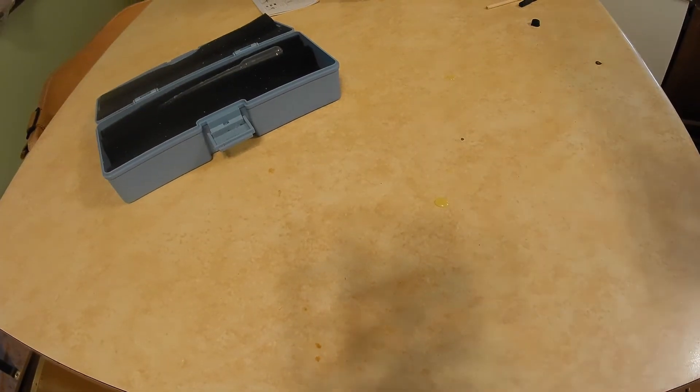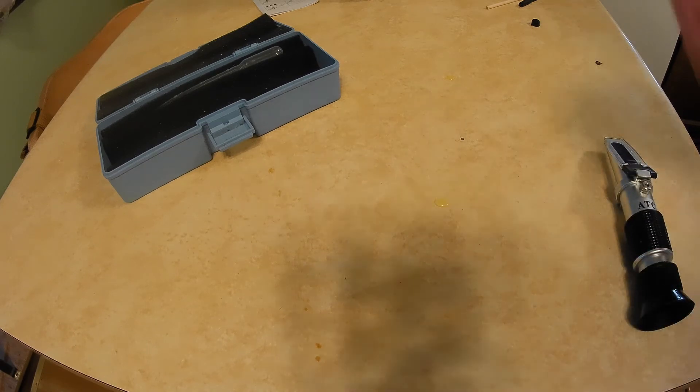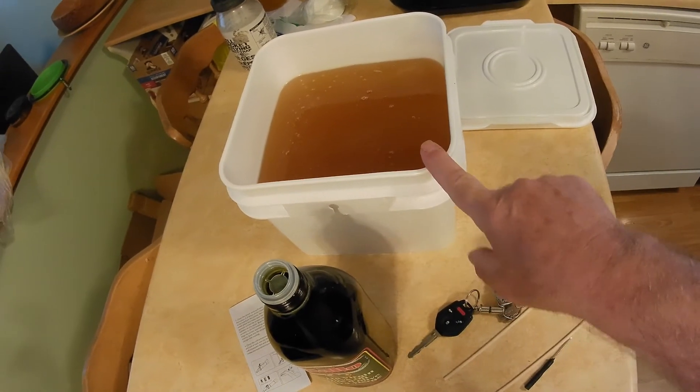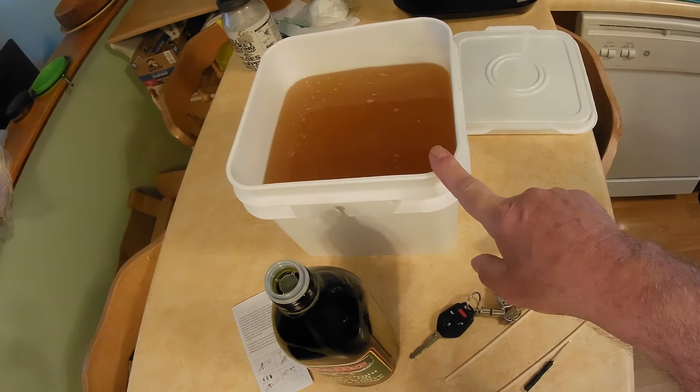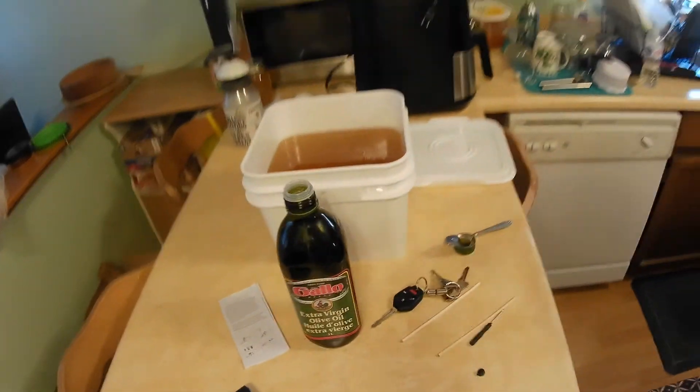Let me take a moment and I'll clean that off. I've got a pot of honey here. This is honey that I brought down yesterday and extracted it already. And we'll do a test on that and see what it looks like.